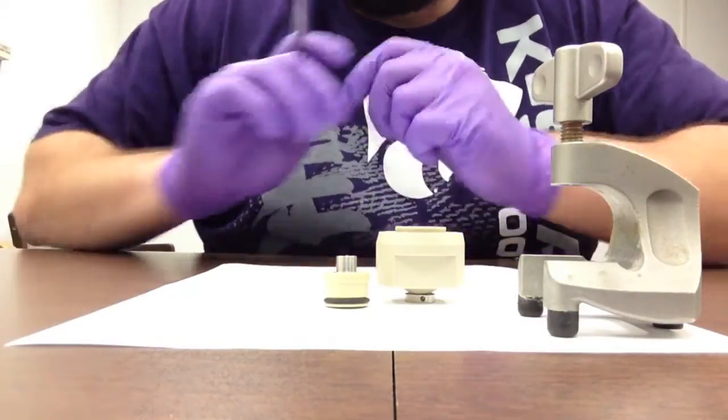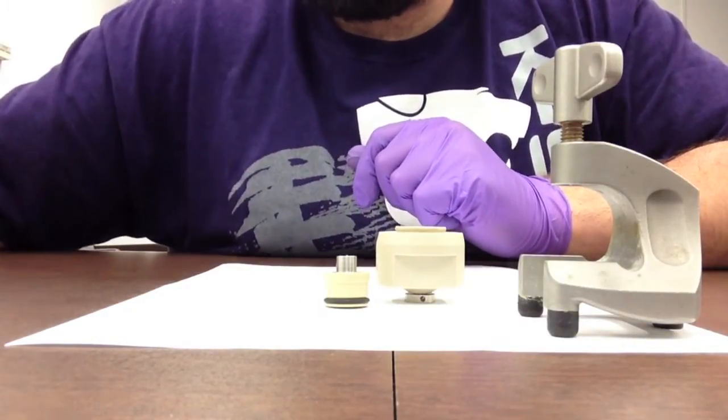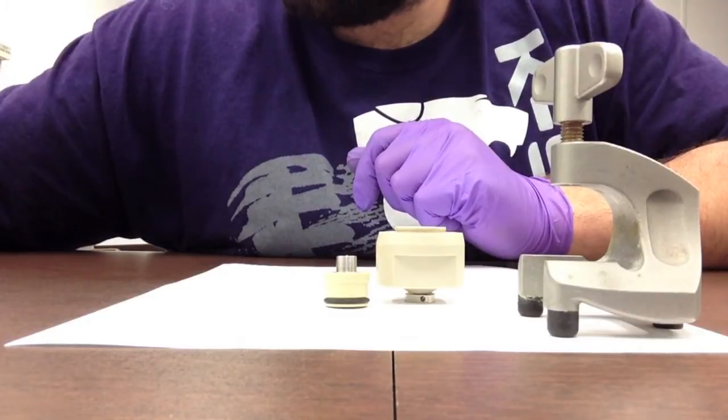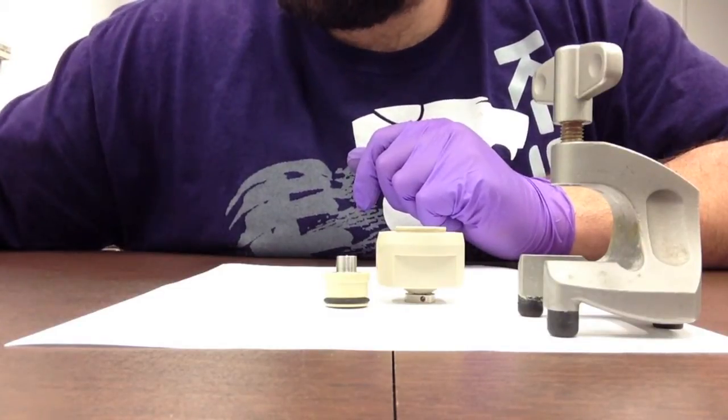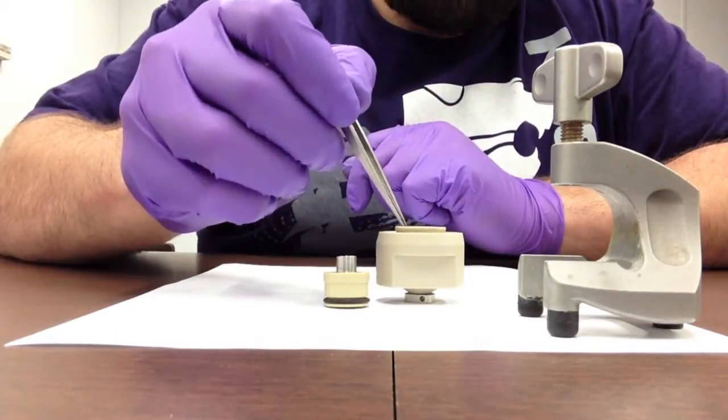We have a special little setup that we go through. With our electrode, I carefully take my tweezers and place the electrode into the bottom of our L-cell base.